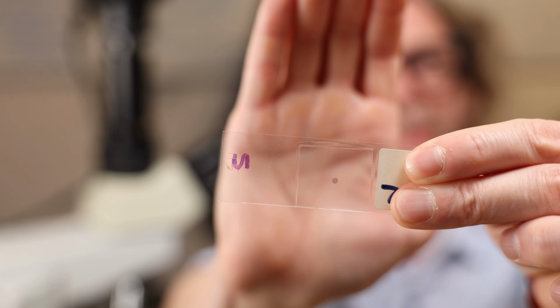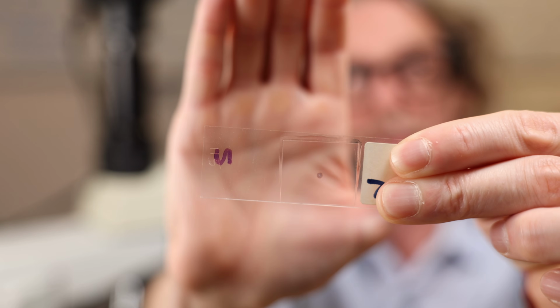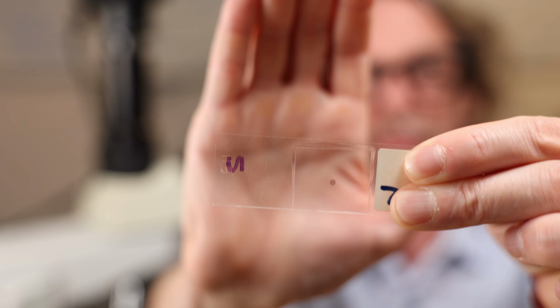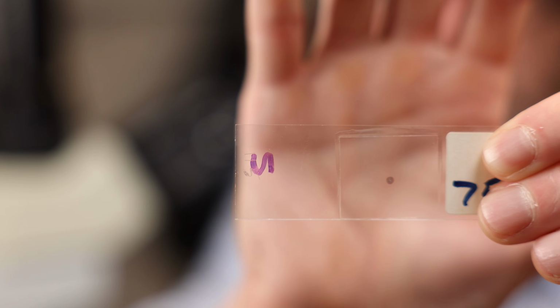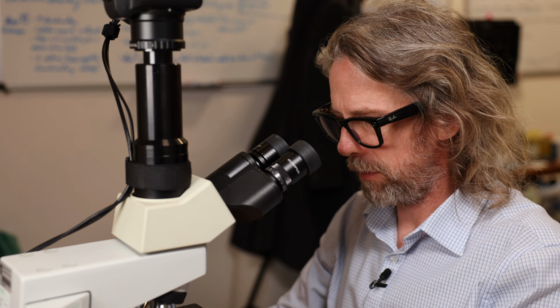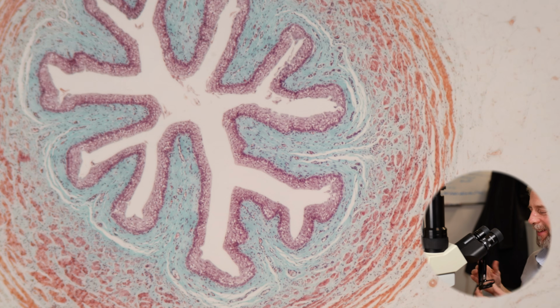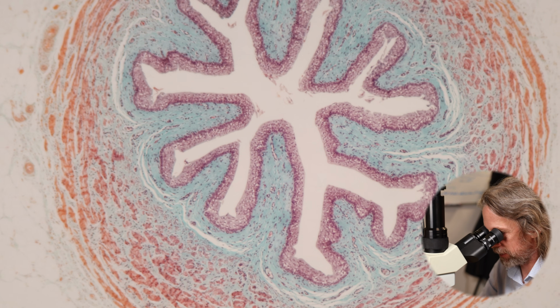It's a little tiny dot. That is the ureter. But to be honest, the ureter in humans is also very small and would easily fit on this slide if I cut it in cross section. Like all good tubes in the body, it's made up of a number of layers so that it's nice and strong and it can do its job. Okay. I can see this. I can see the spot. Wow, look at that. Looks like a tiny esophagus.